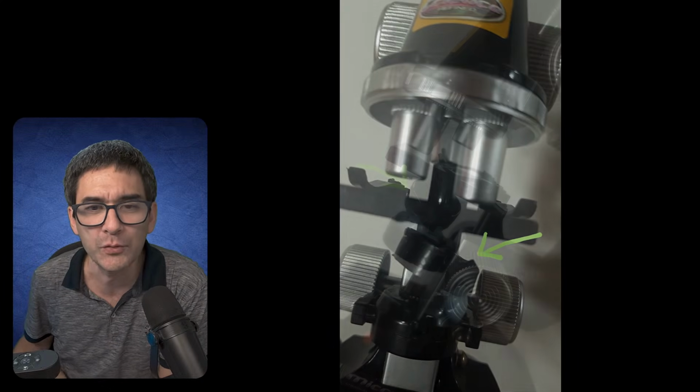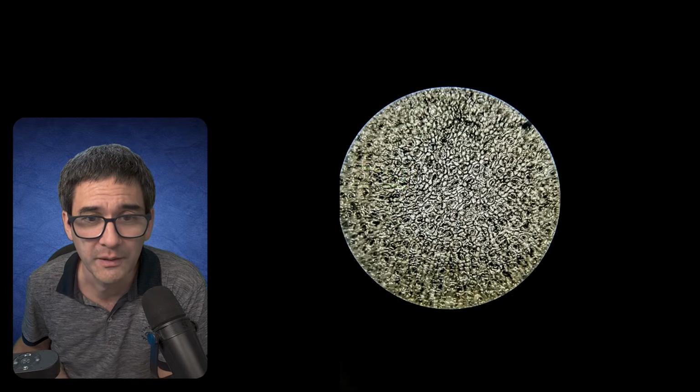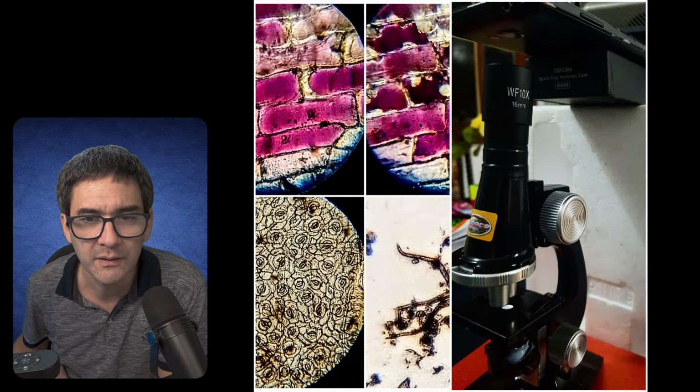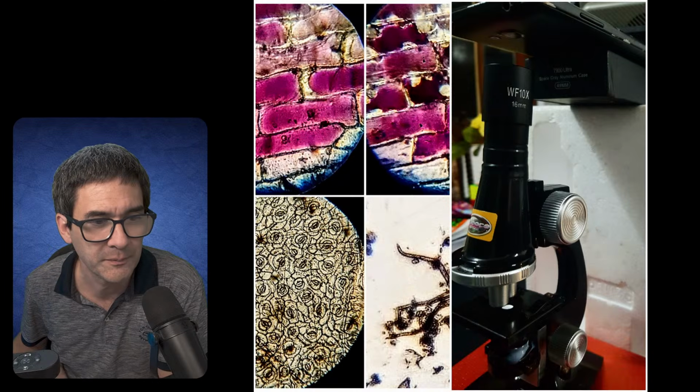This looks almost like a very basic microscope, but the quality is surprisingly good, because there were two modifications made, and I would like to quickly press pause here and show it to you. So thank you very much to Sasiri who sent me the pictures.